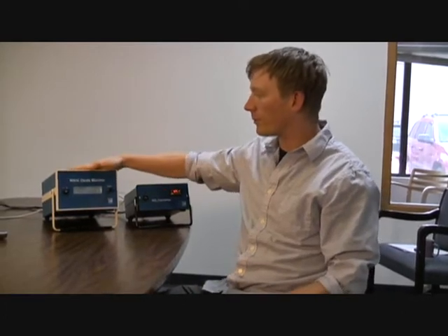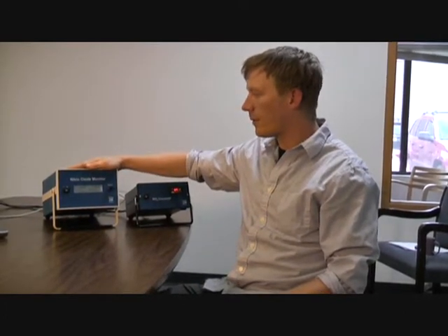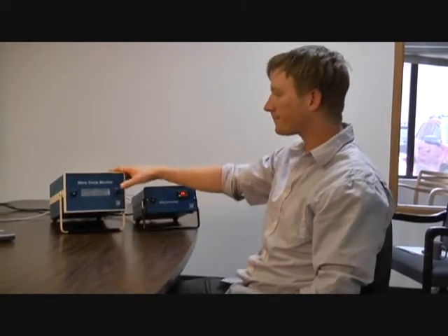In this section, I'm going to be talking about setting up parameter adjustment mode to automatically occur at a certain frequency to ensure that you're producing the right amount of ozone to ensure that your flows are set correctly. They can drift over time, so we do recommend doing this for long-term measurements.